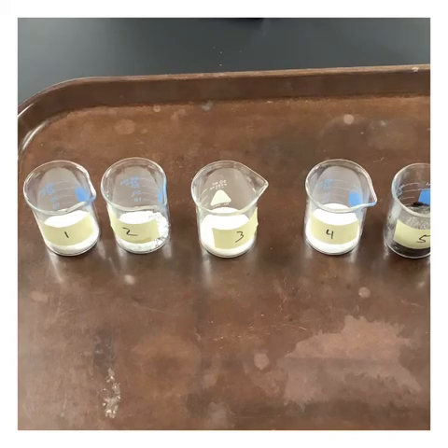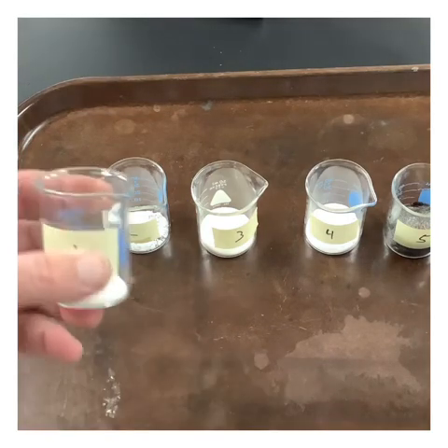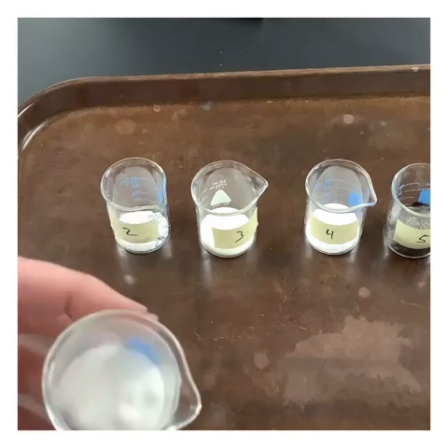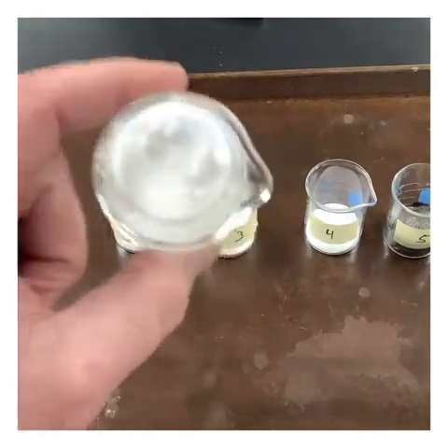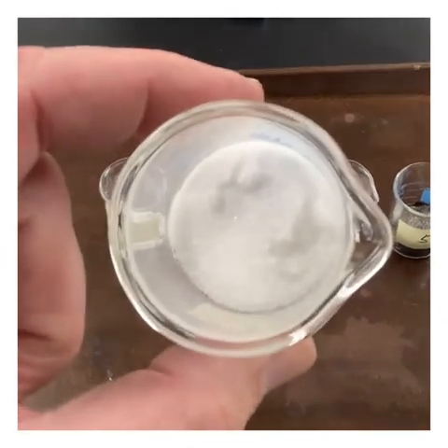If we take a look at the directions here, there's a few pre-lab questions that it's going to ask you to give us some definitions of some different things like malleability and conductivity. But what we want to do now is first make some observations about each of the individual chemicals, and then we want to test their conductivity both as a solid, dissolved in liquid, and then the melting point.